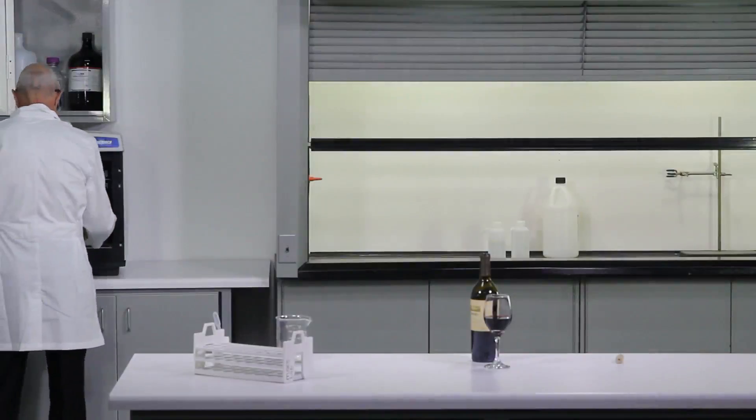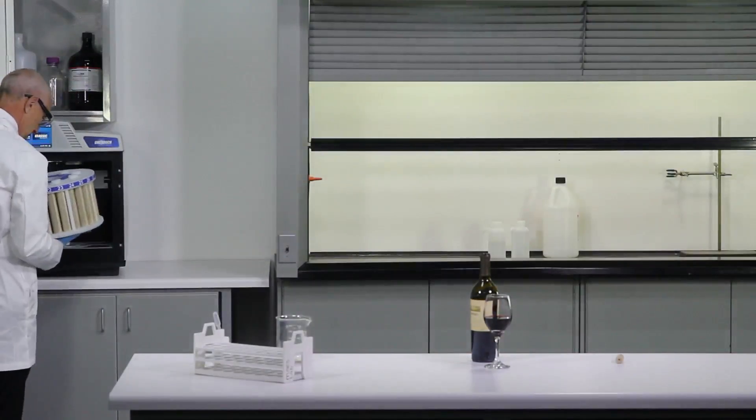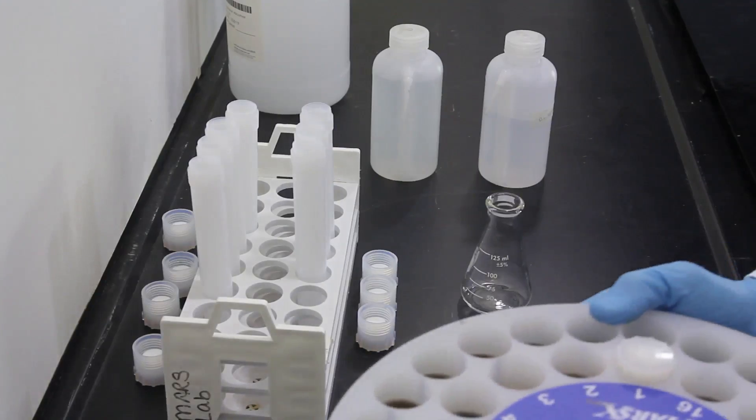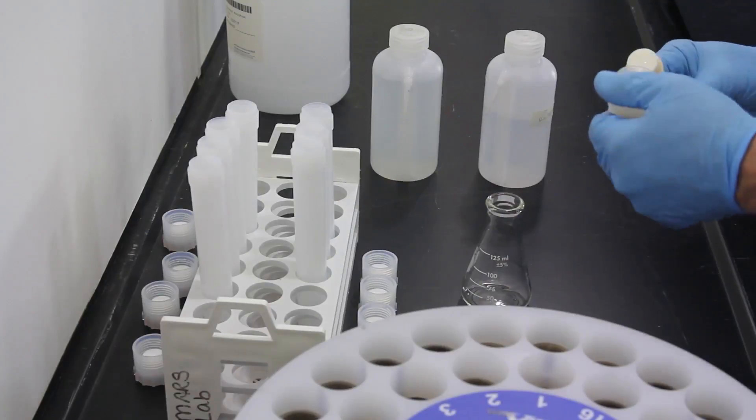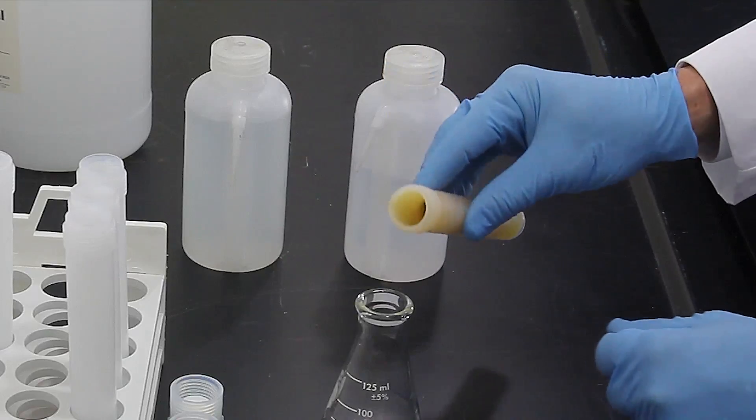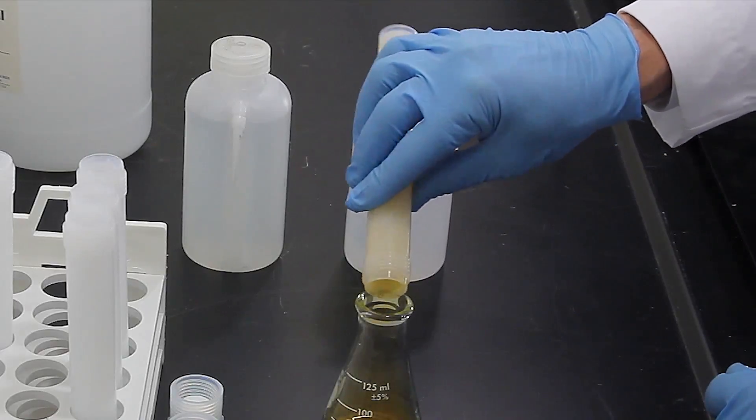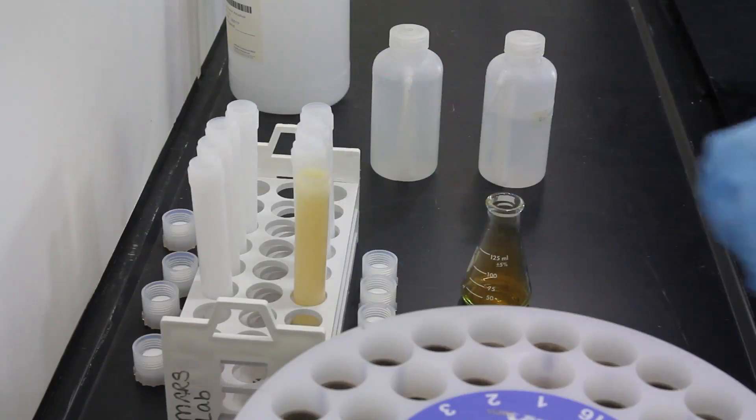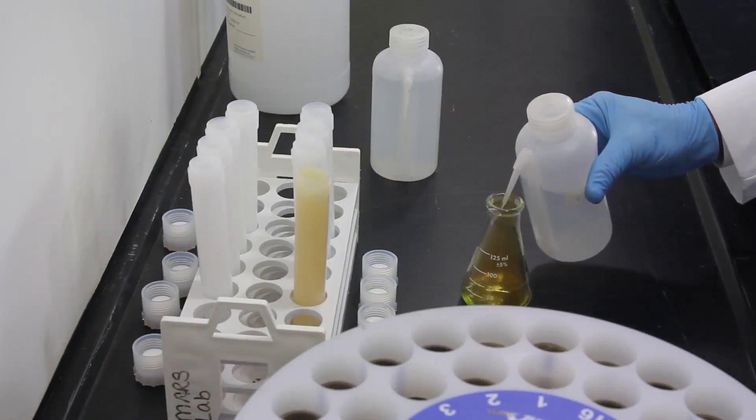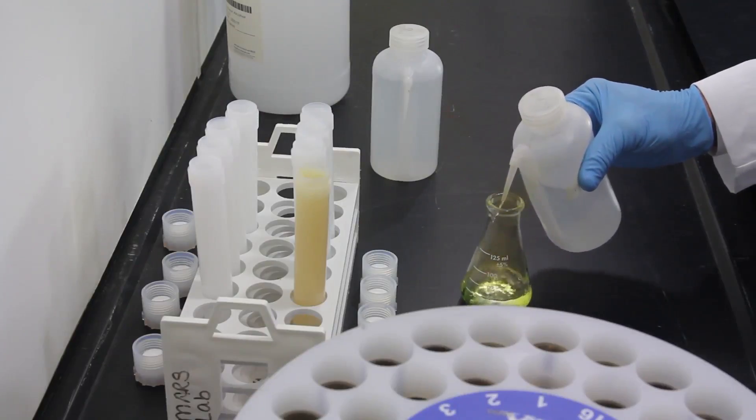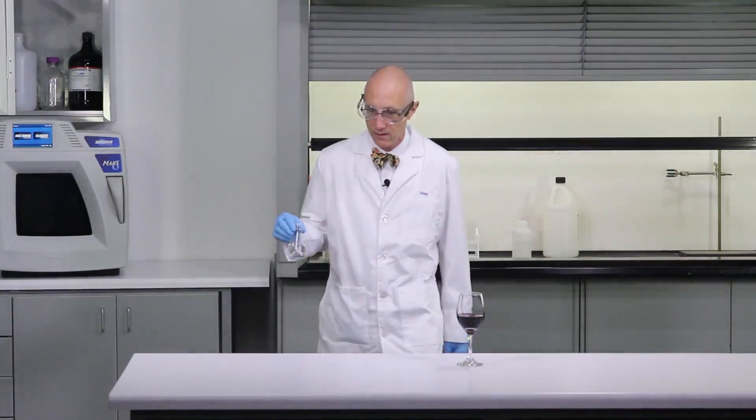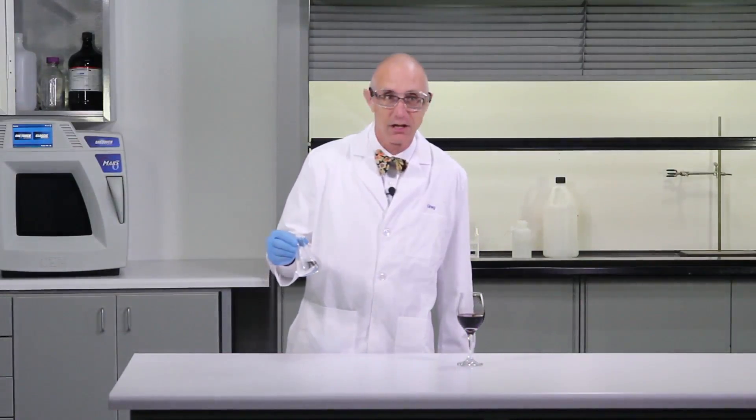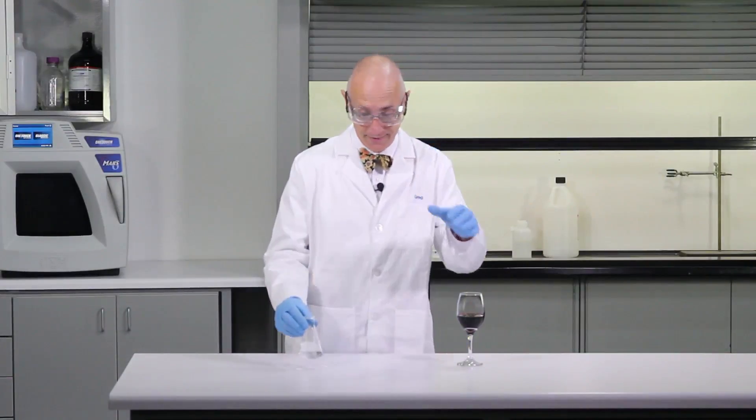Our sample is now completed and we'll pull them out and see what we have. Let's check it out. Will it digest wine? Do we have a nice, clear, colorless solution? Yes, we can. I'll drink to that.